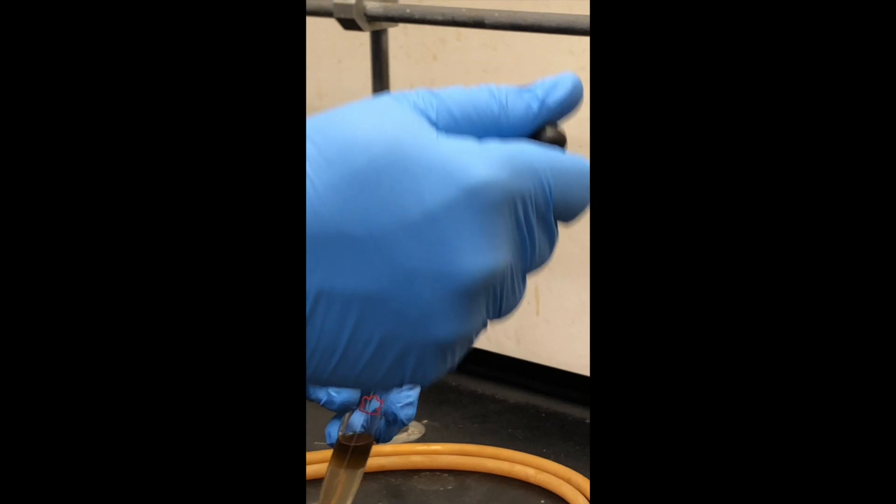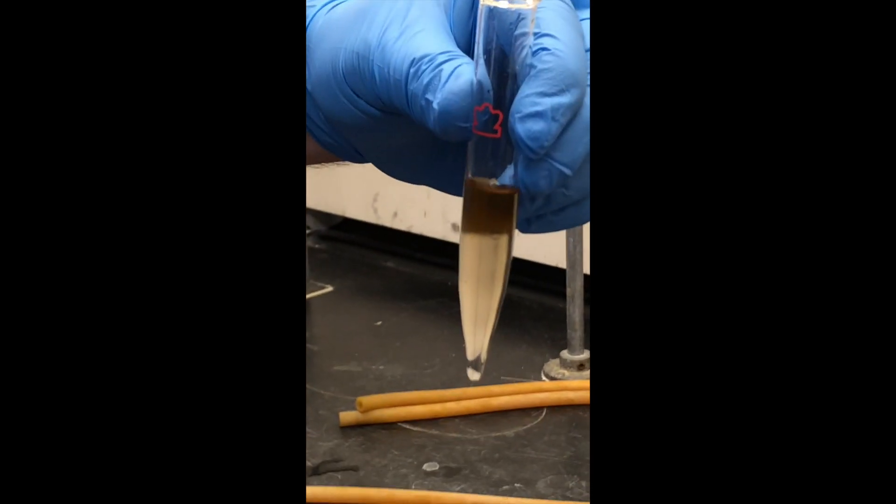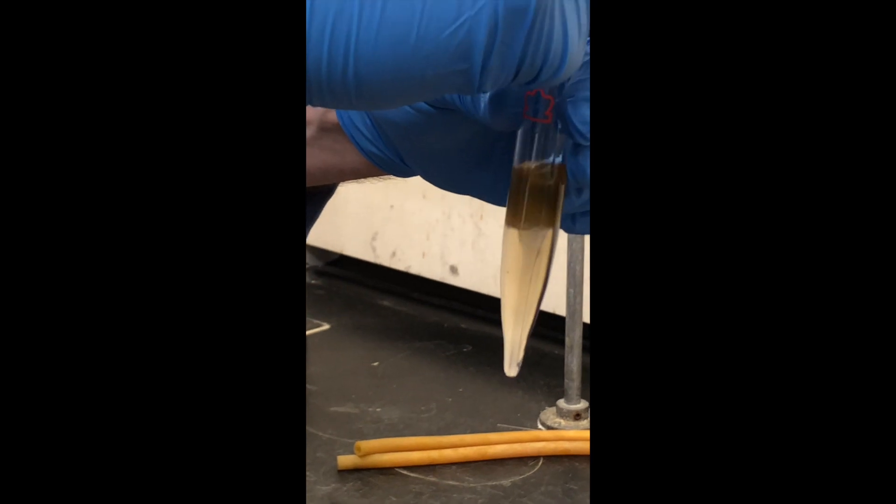And each time you see that the lower layer gets smaller and the upper layer moves down.